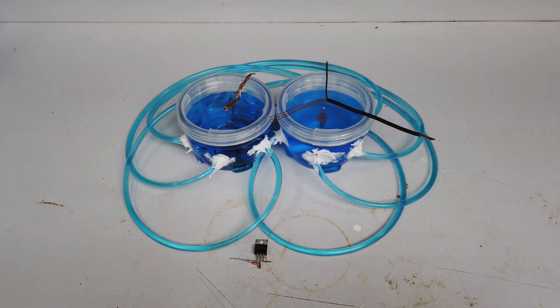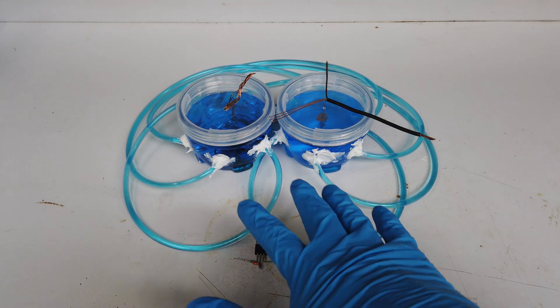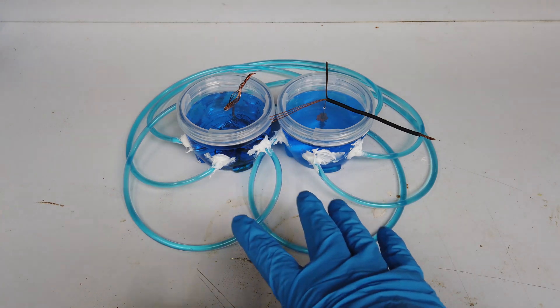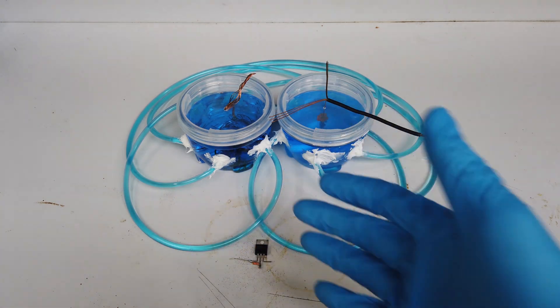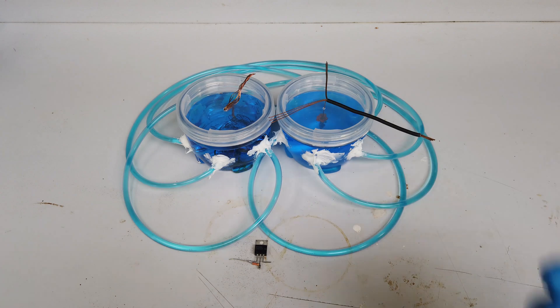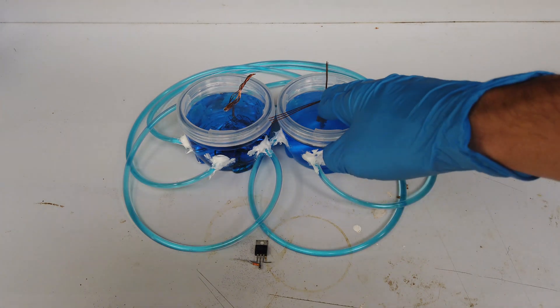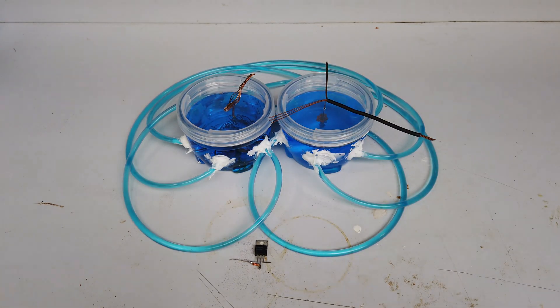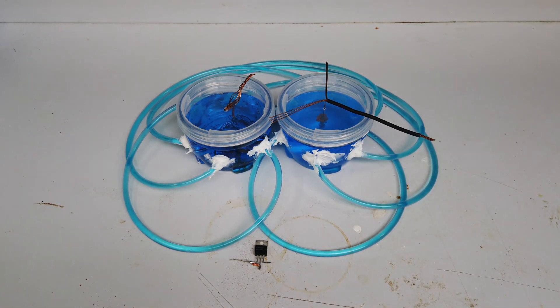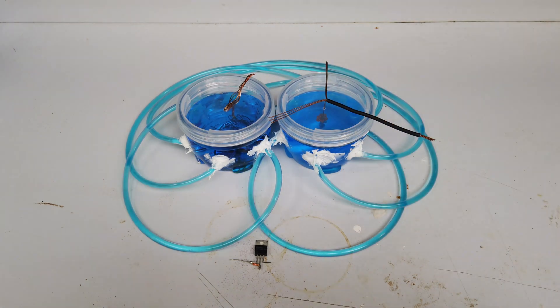About 60 days later, this is where we are. I have finished running the cell not really by choice. I wanted to run it for three months, but the power to the lab disconnected yesterday and I'm pretty sure that having the crystal just sitting in the solution without constantly being cathodically protected by the potential that we're applying is possibly not good for continued crystal growth. So I'm going to stop it right here.